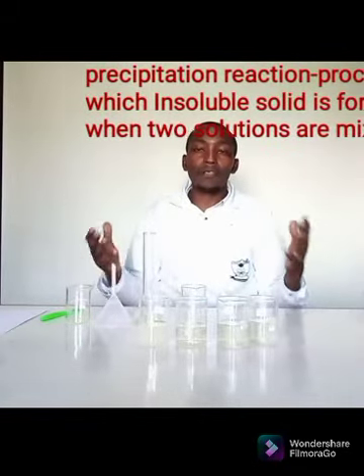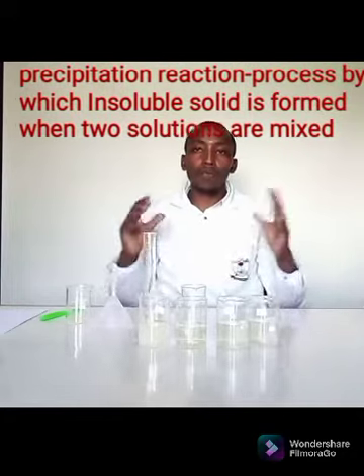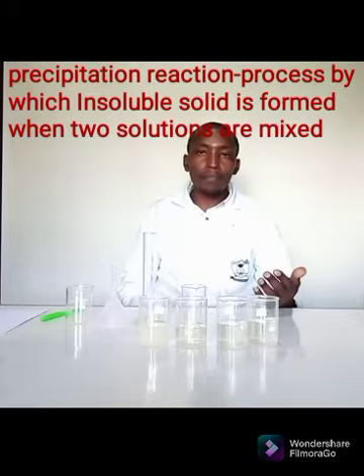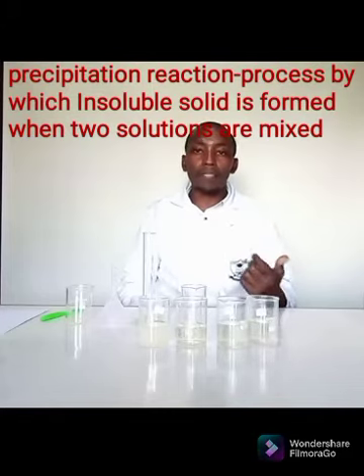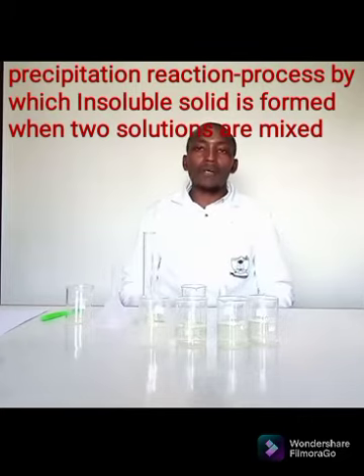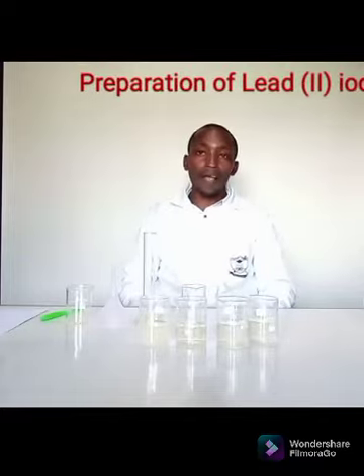You're asking yourself, what is a precipitation reaction? A precipitation reaction occurs when you have two solutions, and once you mix them, you get an insoluble salt or an insoluble substance. That is what we call a precipitate. Otherwise, it is the salt that has precipitated out. Why double decomposition? Because the two solutions will decompose, and finally you get the salt that you are intending to prepare. To start with, I'm going to prepare lead II iodide.